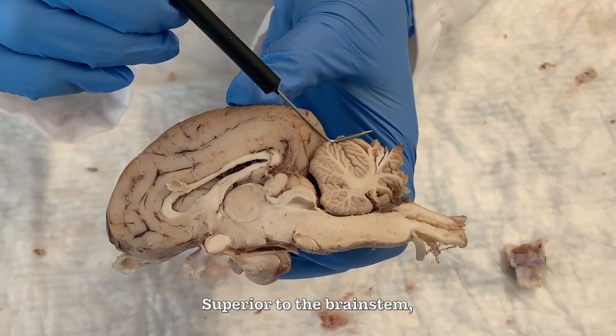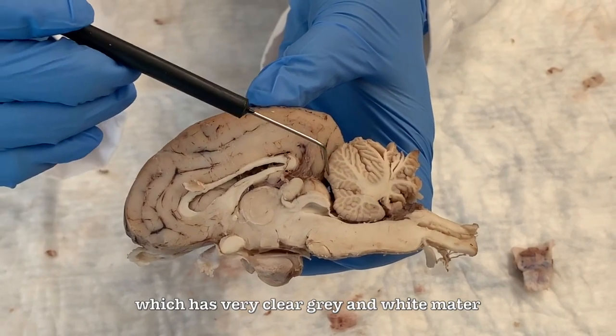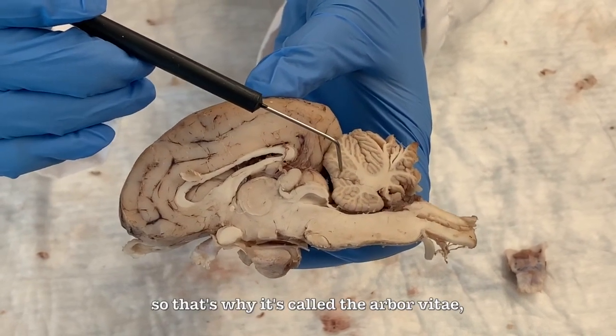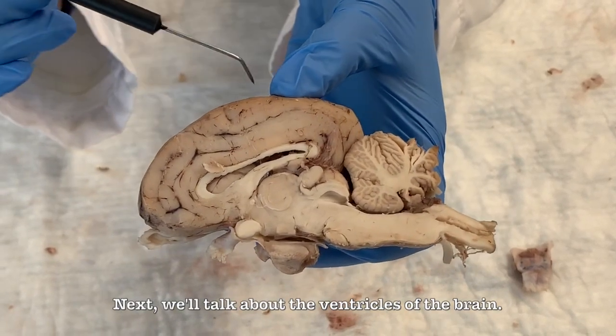Superior to the brainstem, you can find the cerebellum, which has very clear gray and white matter, and the white matter is branched sort of like a tree, so that's why it's called the arbor vitae, which means the tree of life. Next, we'll talk about the ventricles of the brain.